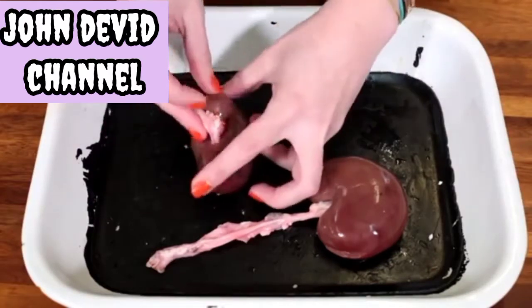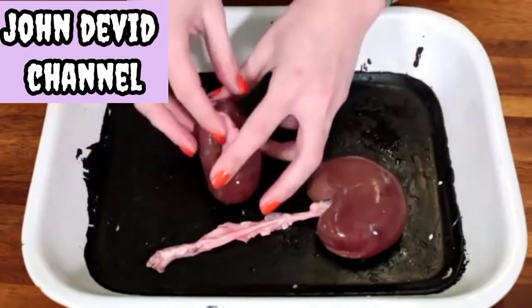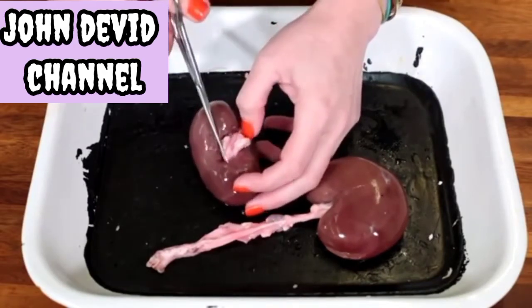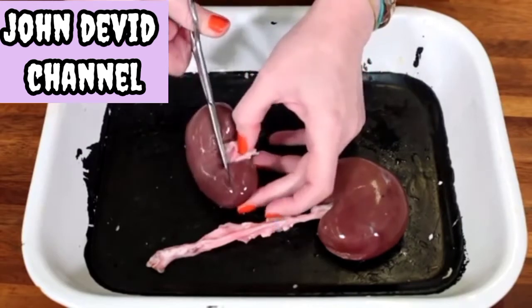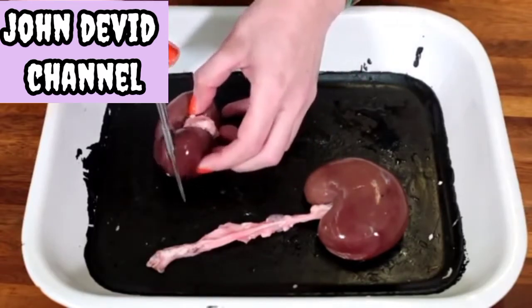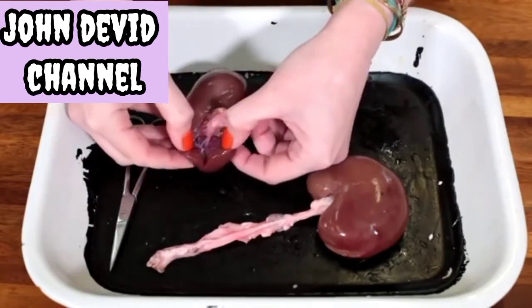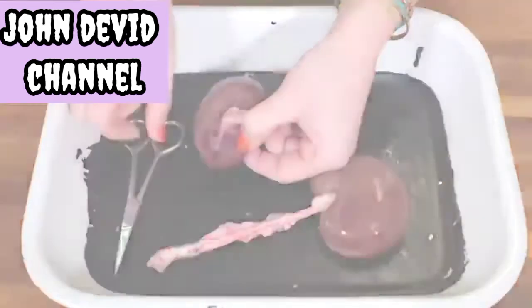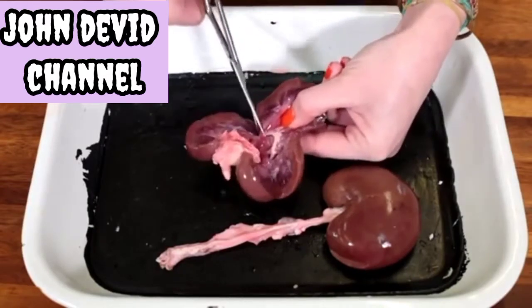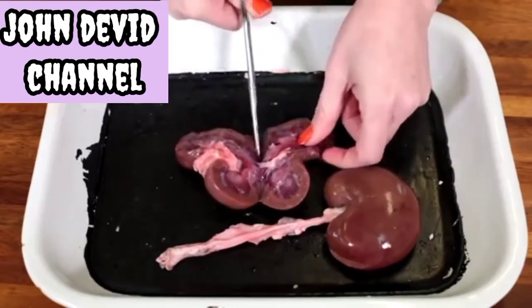You can cut the kidney clean in half with scissors or scalpel to open it out like a book. Be careful not to cut into those vessels and simply snip all the way through. It's quite soft tissue, and you can start to open it. The kidney organ is symmetrical, so continue cutting all the way down the centre until you have two halves opened up.